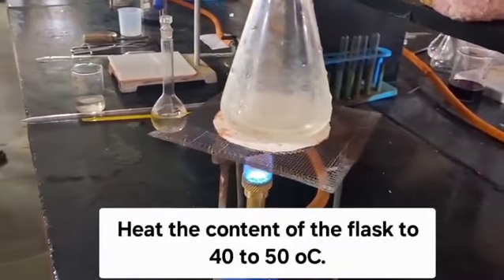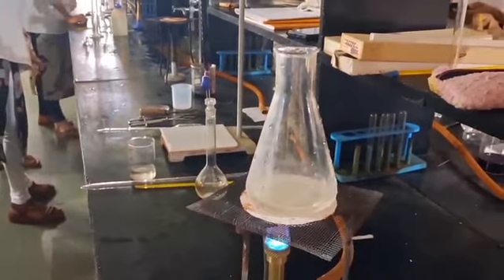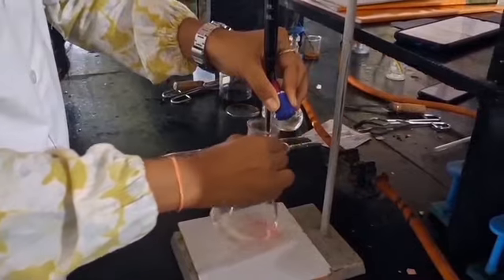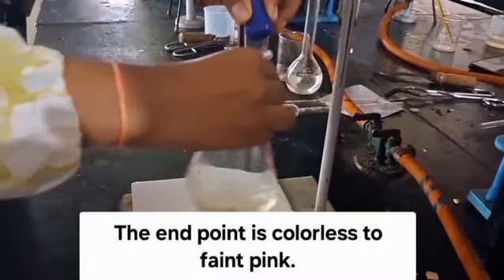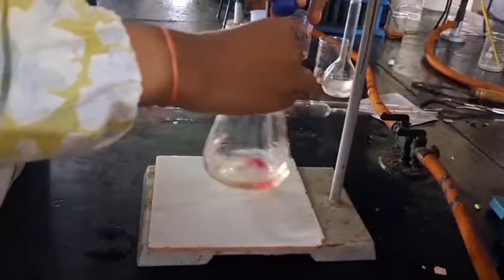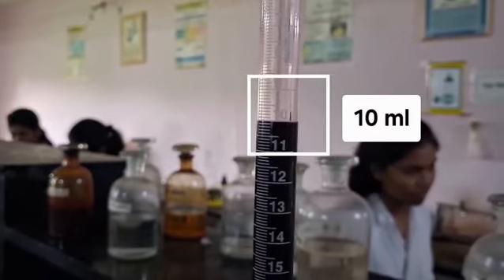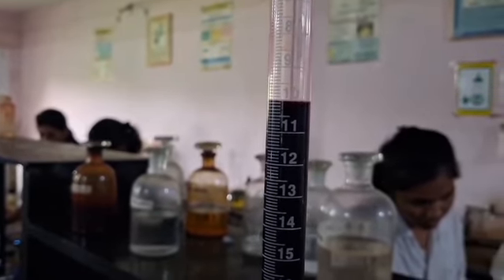Heat the contents of the flask up to 40 to 50 degrees Celsius. Titrate the content of the flask under hot condition with 0.1 normal KMnO4 solution till the end point, colorless to faint pink. The burette reading is 10 ml. Take 2 more readings to get constant burette reading.